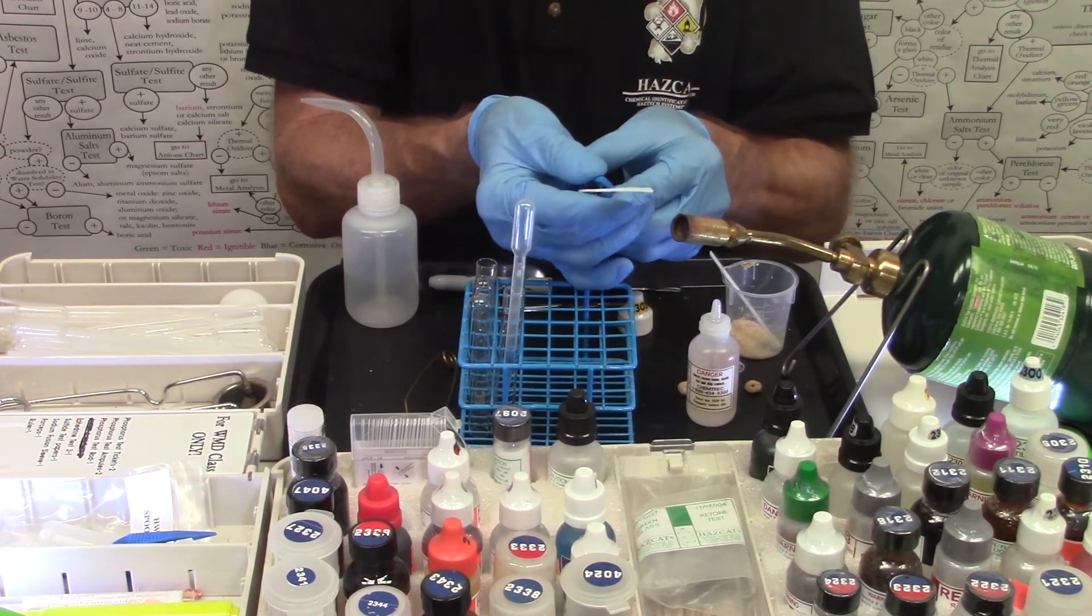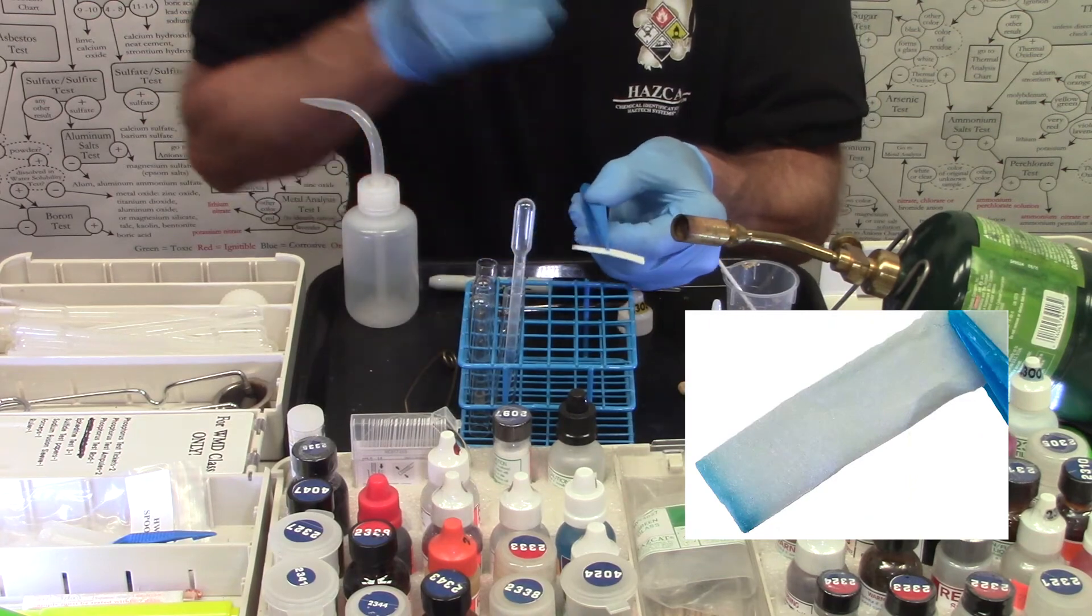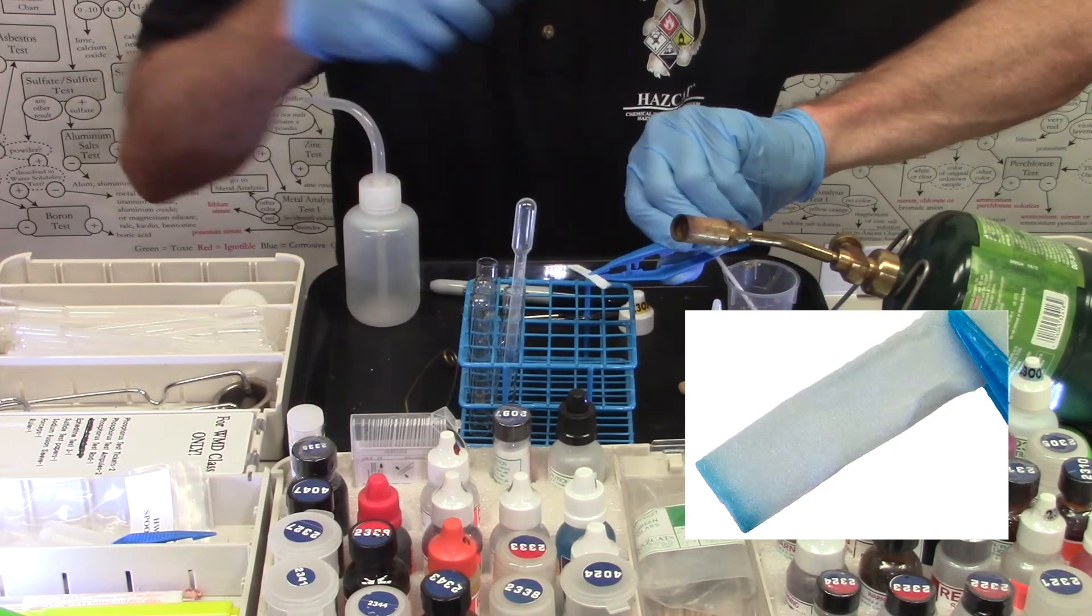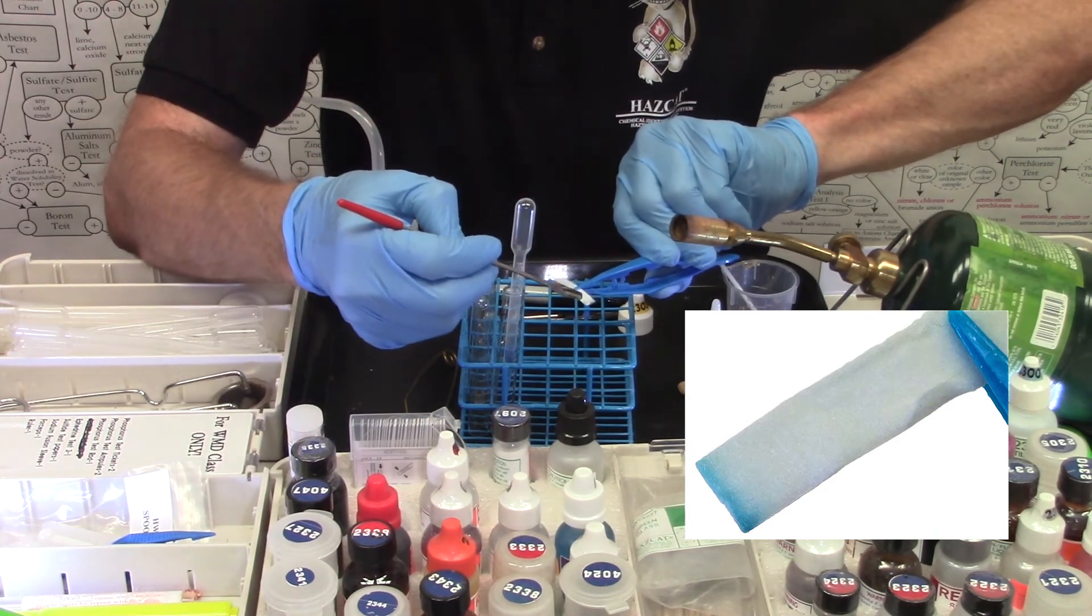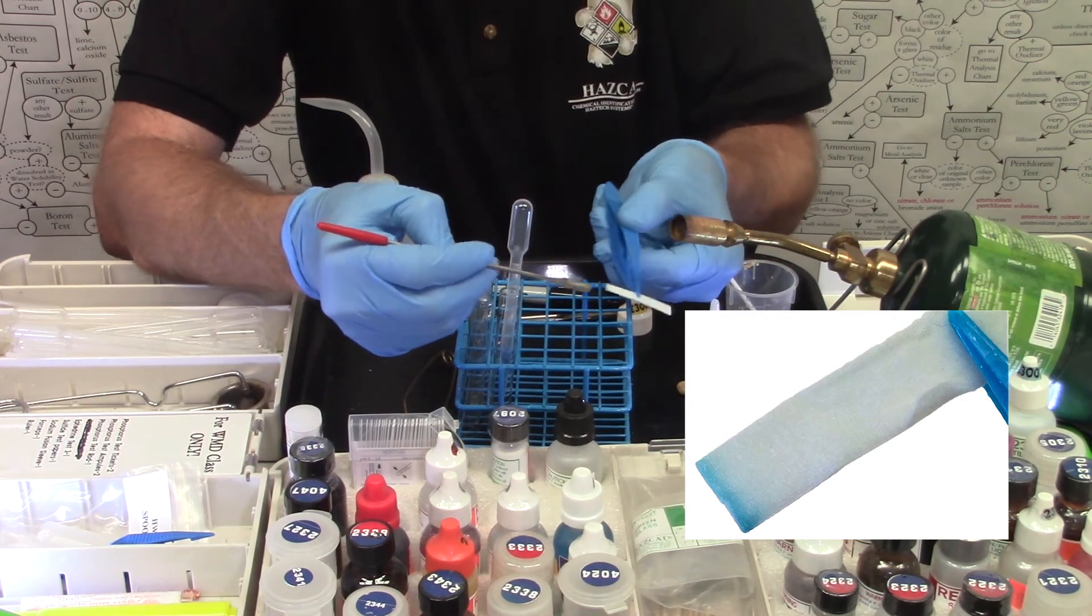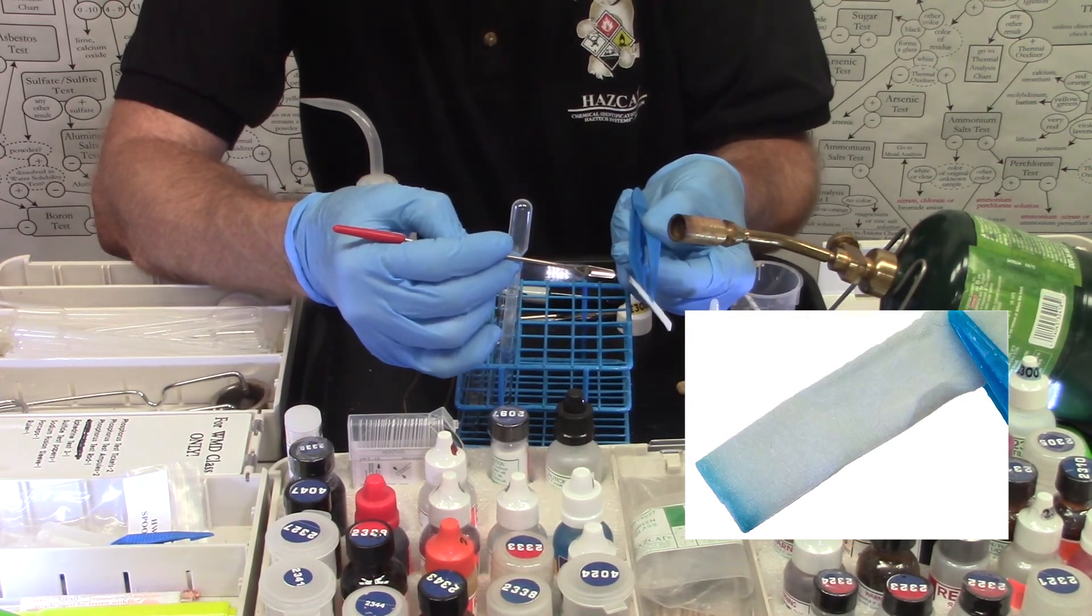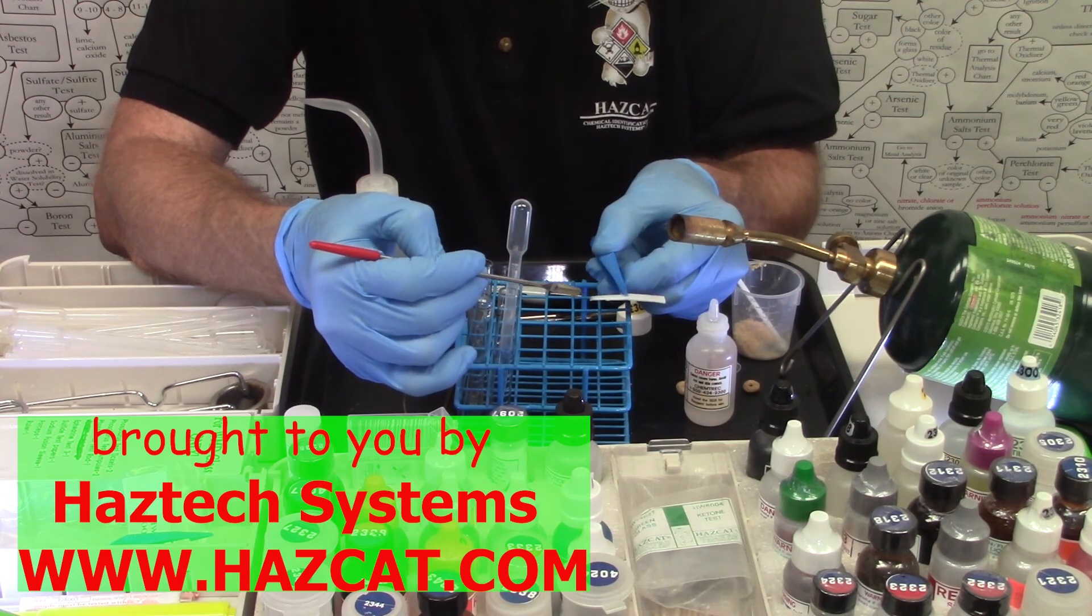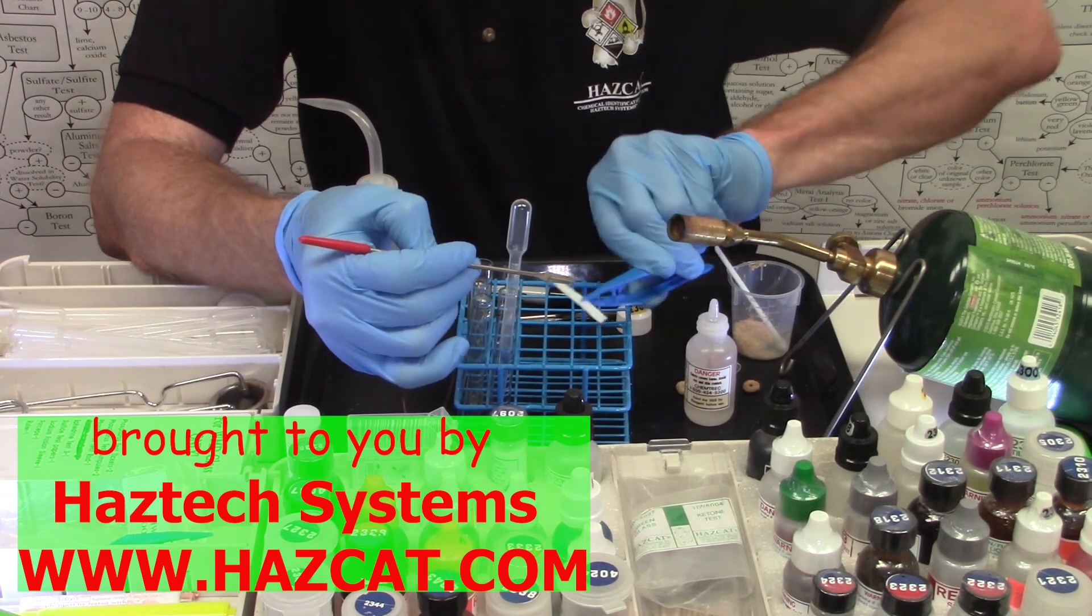I want to know if someone has tried to poison me. And I can start seeing just right here, a bunch of blue forming at the tip of the paper there. Some navy blue color. You can see it at the end really well. So yes, the Cheerios were laced with cyanide. This is considered a positive test.